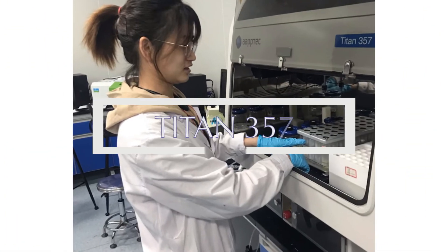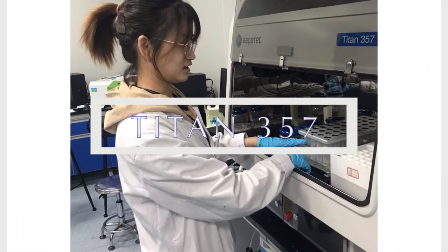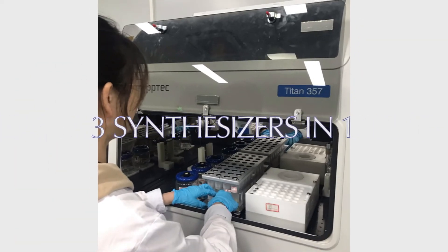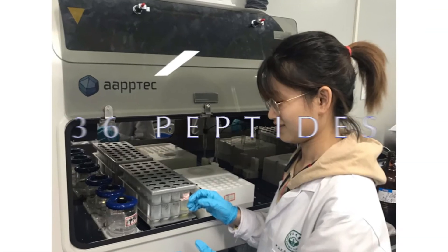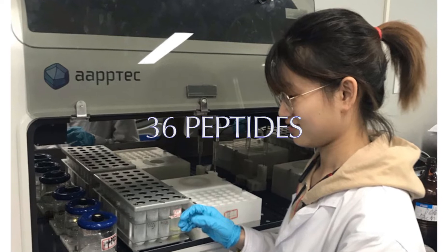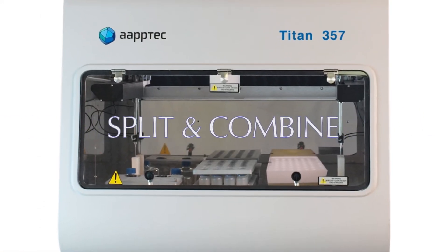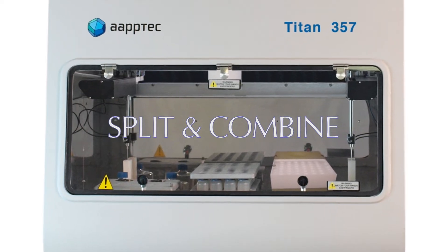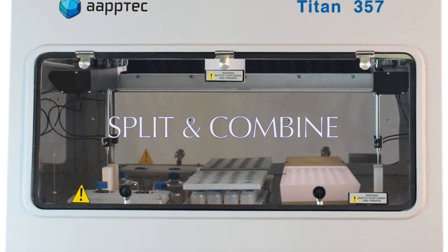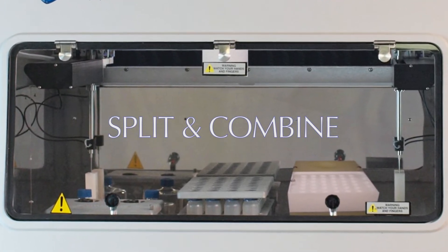The Titan 357 synthesizer is a powerful tool for drug discovery. It serves as three automated synthesizers in one: as a parallel synthesizer it prepares up to 36 peptides simultaneously; it is also a 550 milliliter scale-up synthesizer, as well as a split-and-combine synthesizer for preparing combinatorial peptide libraries. It can prepare split-and-combine libraries containing millions of compounds for high throughput screening and lead discovery.